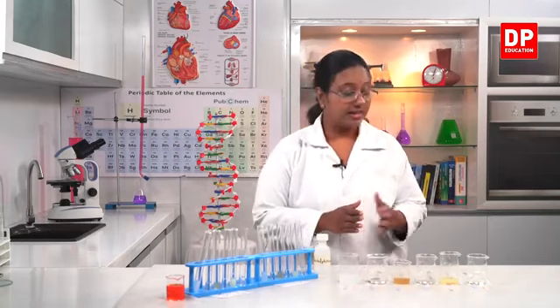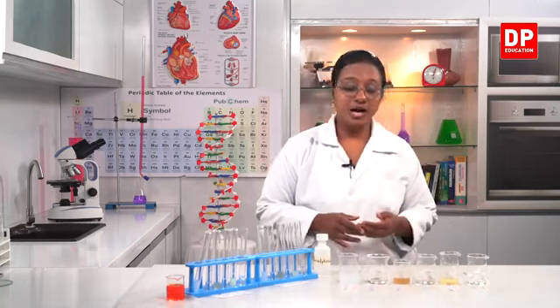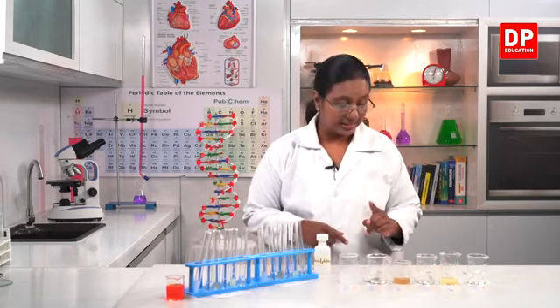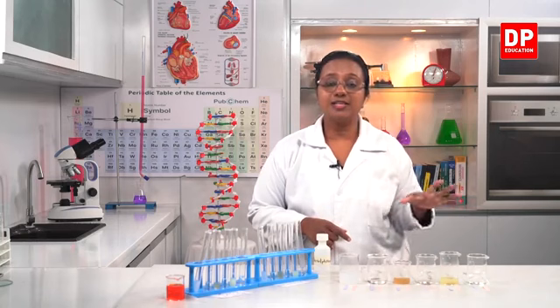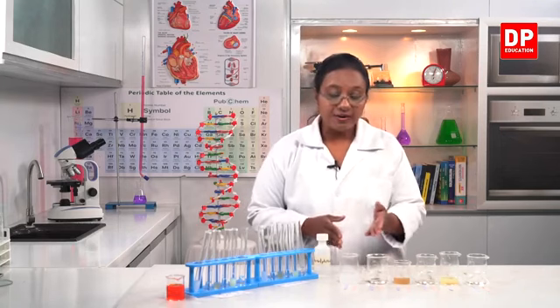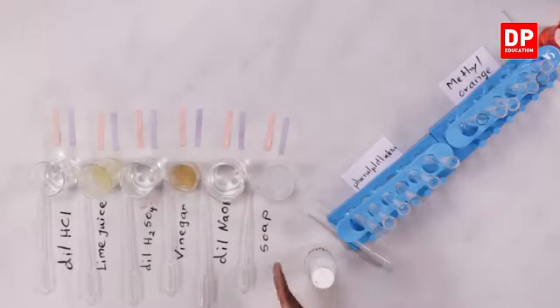So to identify them, I have a few samples given to you here. The first one is dilute hydrochloric acid, lime juice, sulfuric acid, vinegar. So you know these are all acids, and out of these, dilute sulfuric acid and dilute hydrochloric acids are acids usually available in the lab. Lime juice and vinegar are usually used at home. And we have dilute sodium hydroxide, the base commonly used in the lab, and soap, that again is a basic solution that is used at home or available at home.